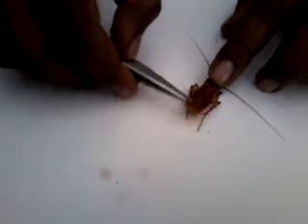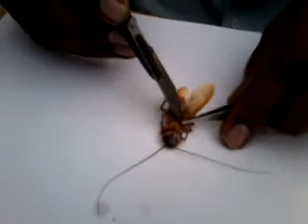Now we are going to remove these wings. The hind wings are used for flight — they are thin, broader, and membranous in nature. This hind wing can be clearly seen here and is useful for flight.